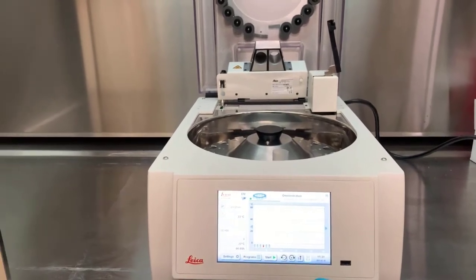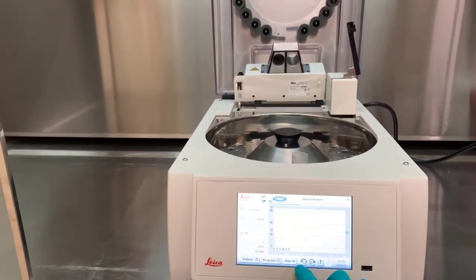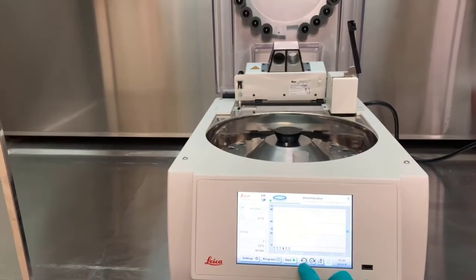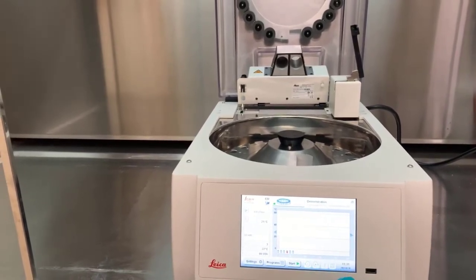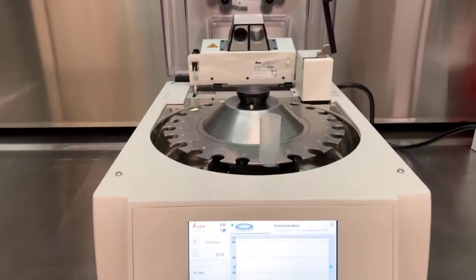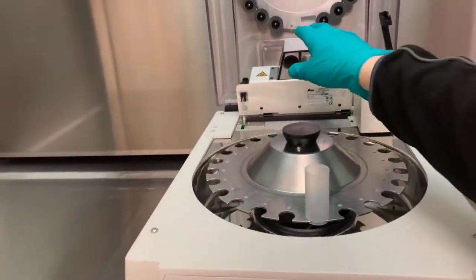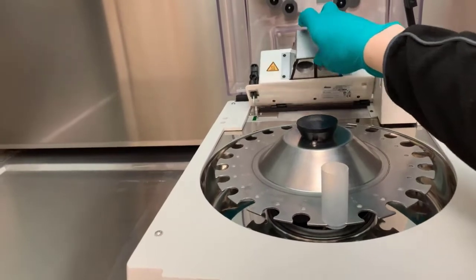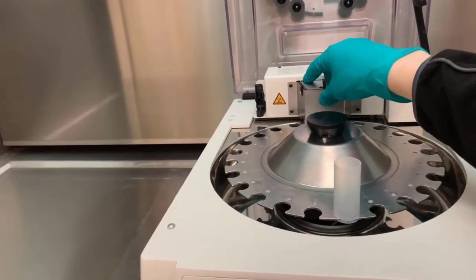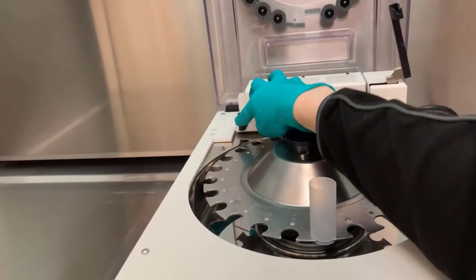A fully loaded carousel should be lowered before lowering the heater-cooler unit. The heating-cooling unit, when there are no vials blocking it, can be lowered and latched into place.